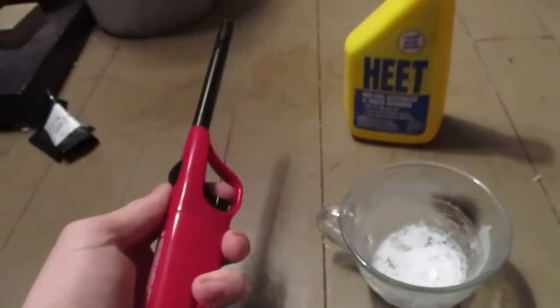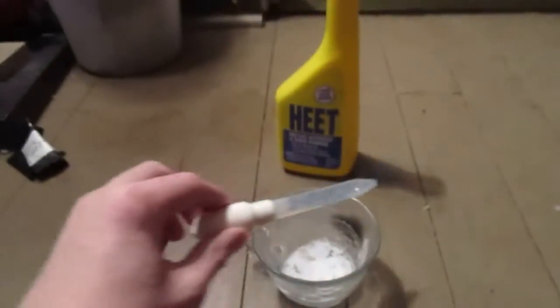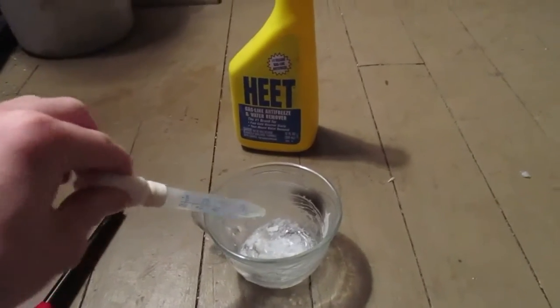What I'm going to do is take some methanol, which I have in that little dropper thing, and I'm going to light it on fire — well, I'm going to mix it a little bit first to dissolve some. This might be reusable but I'm not sure. So I have that in there now, I'm going to mix it.